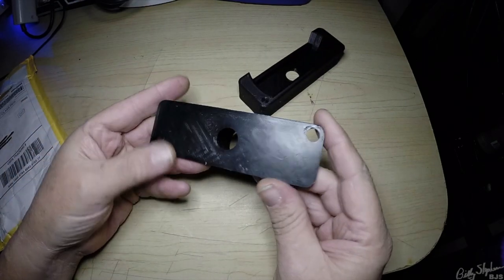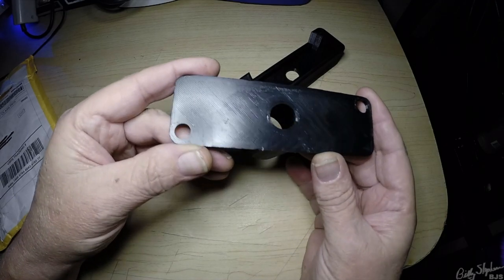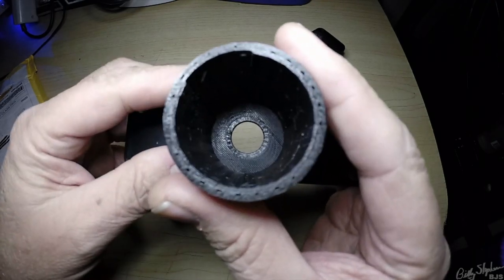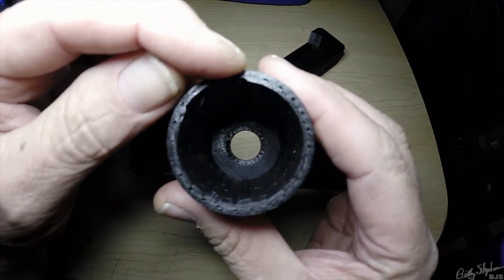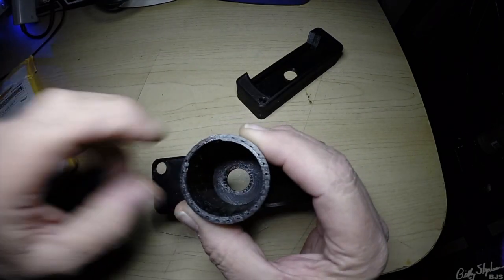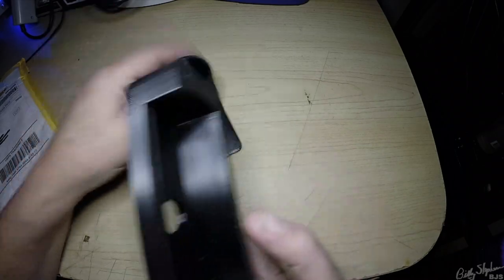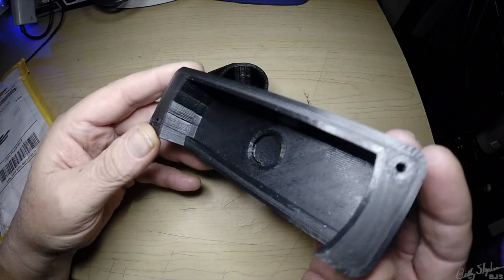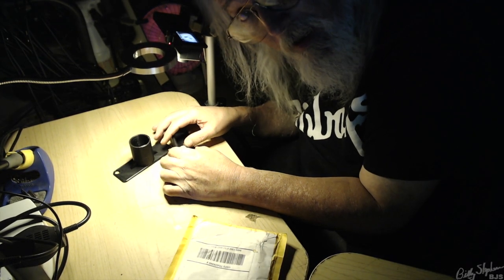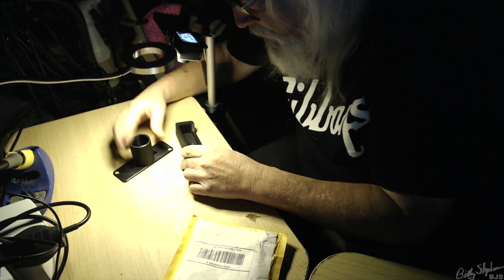This one here — we're adequately flat on that. Get that light to roll around there. Very good. We've got the hole, we've got the little notch that I wanted in that area. That's to accommodate the screw. I think it looks great. Same with here — and like that. Sometimes you've got to reach around the camera and deal with all this kind of stuff, but yeah, this is pretty good.